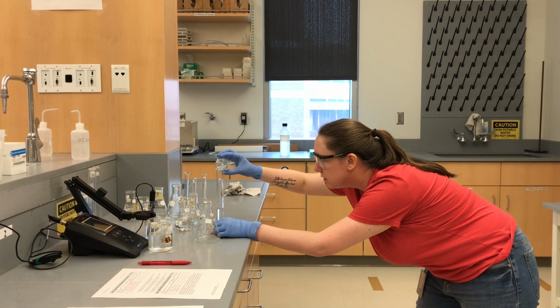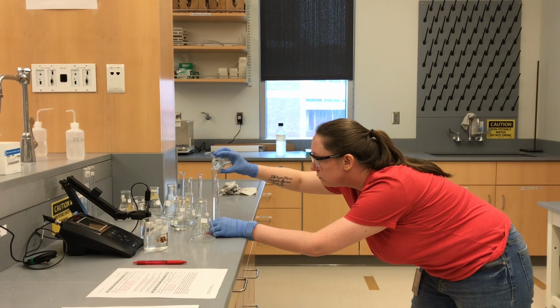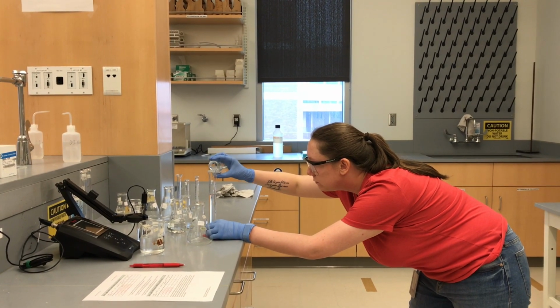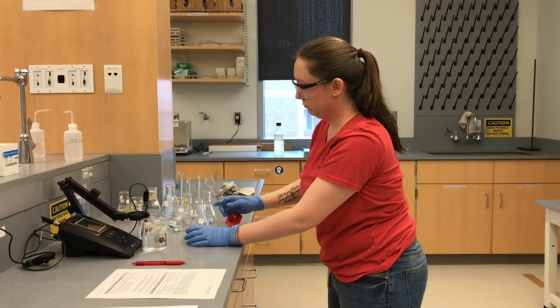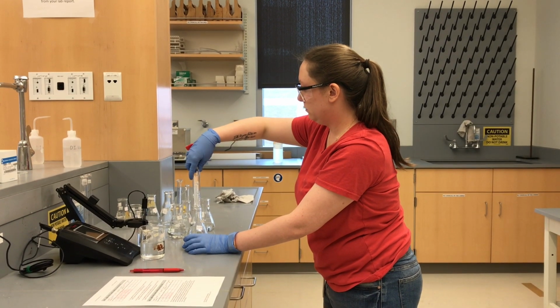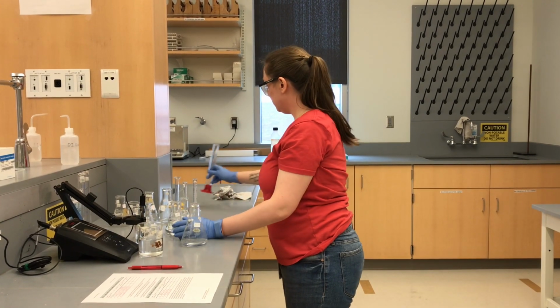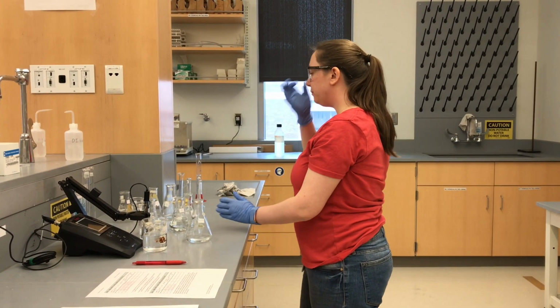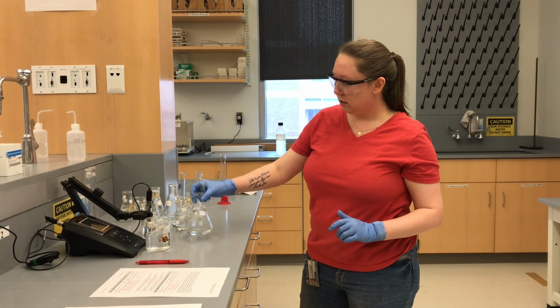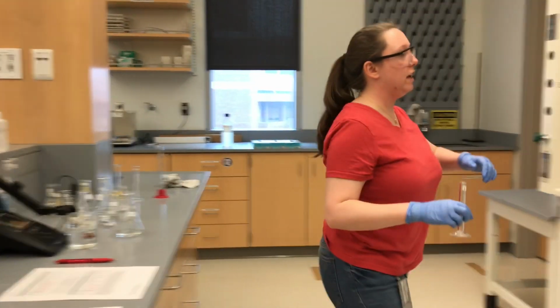So this is our E solution, and we want 40 mils. E 40 mils, and we're done with that. And we want 2 mils of our 0.05 HCl.